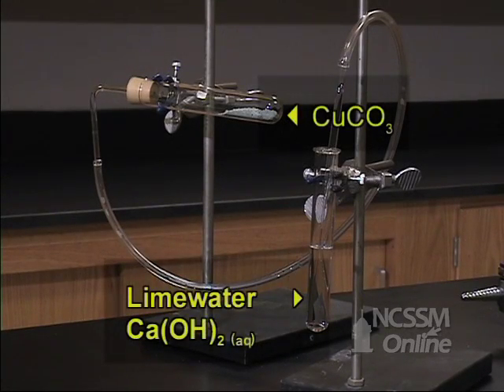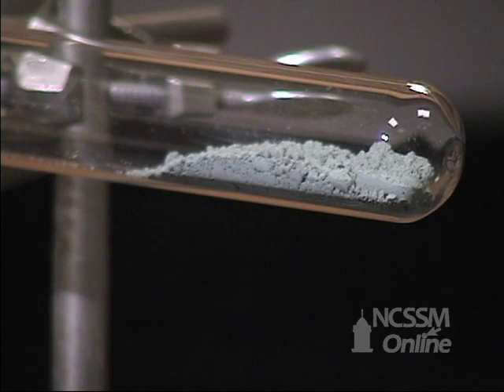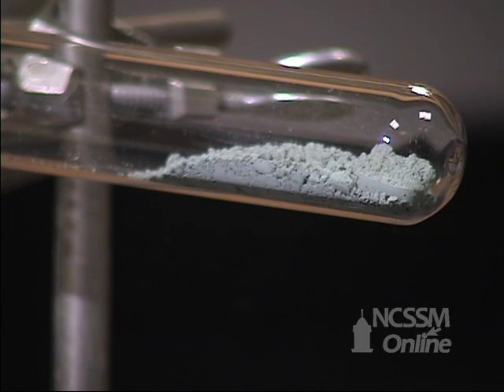There are many indications that a chemical change is occurring. In the decomposition reaction that we are going to observe, we have some blue-green copper-2-carbonate that we are going to heat.